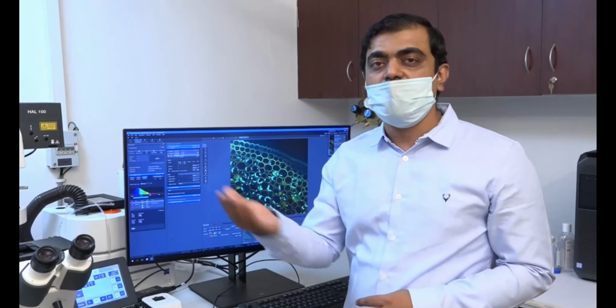So once I have decided the plus Z and the minus Z of the sample, I'll select all the 3 tracks and then start the experiment of taking the Z. It will take all the Z positions of each of the channels. It will first go in the red channel, take Z position from plus Z to minus Z, complete the entire Z stack, go to the next channel where it will take the green. In the green it will again cover from plus Z to minus Z, which is already predefined, and a similar process will also be done for the DAPI, that is the blue.